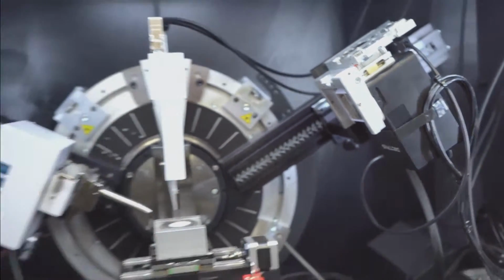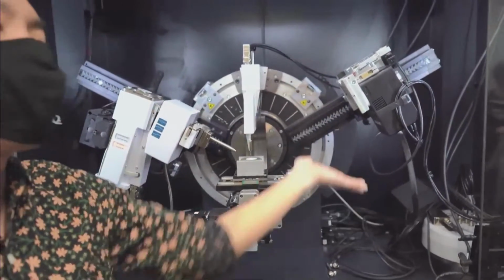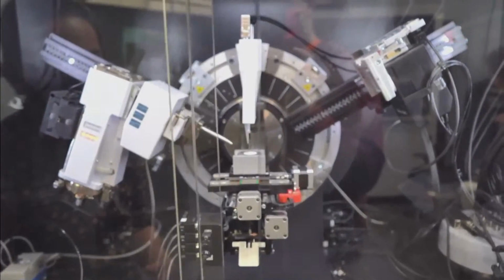Okay. And if you had that new 250K version of this, it's a square sensor. It would be a square. So you don't necessarily have to turn it. You would never need to turn it. But for the 500, we're going to go ahead and take advantage of that extra coverage.